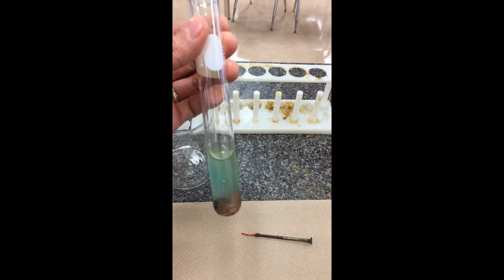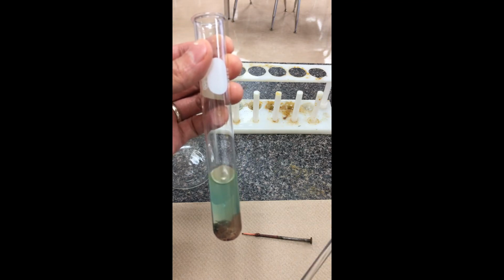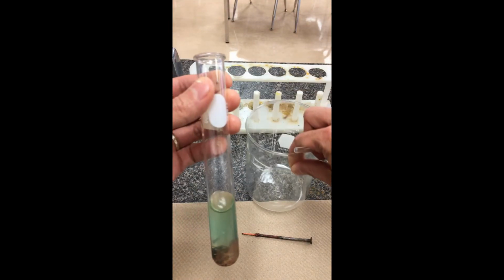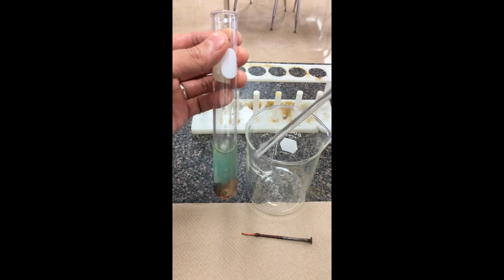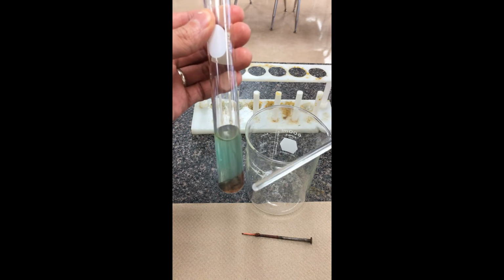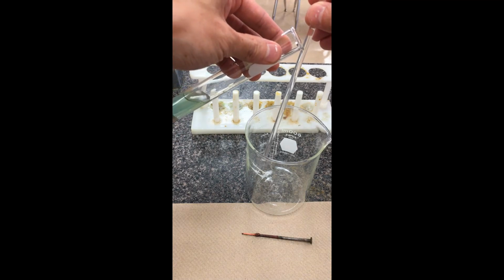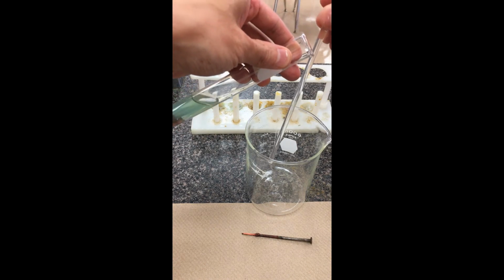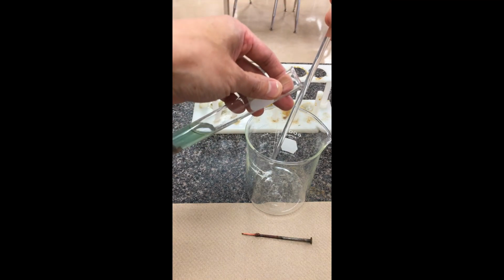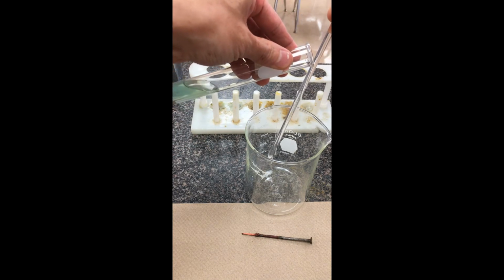What I can do here is a technique in filtering. Instead of using a filtering paper, we're going to be using a process called decanting. I just have a beaker here. I want to get the liquid and toss it into this beaker, but I want to keep all the solid, if I can, inside the test tube. So you're going to pour this test tube, pouring the solution slow enough against the side of this glass stir rod. The liquid is going to fall down where the stirring rod is pointed, which is into this beaker, and I'll hopefully be able to trap all the solid inside the test tube.